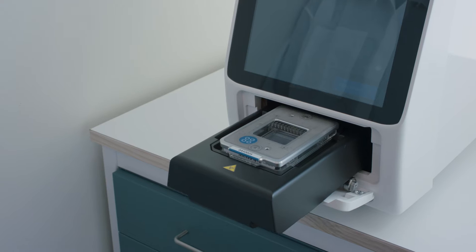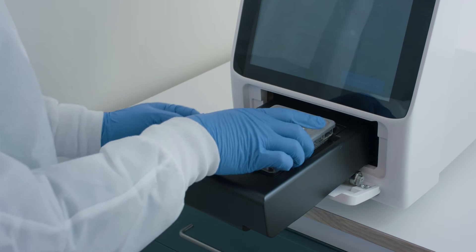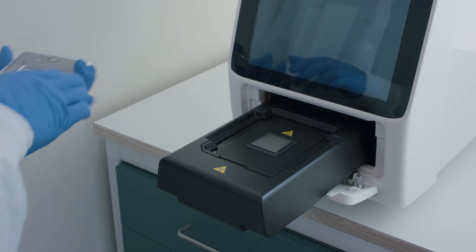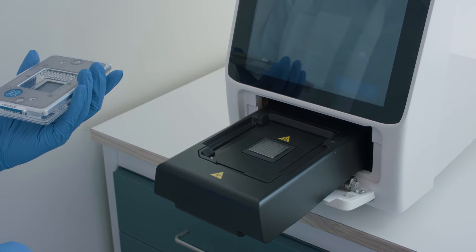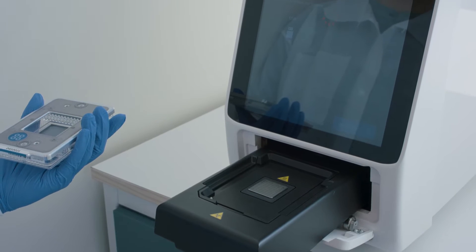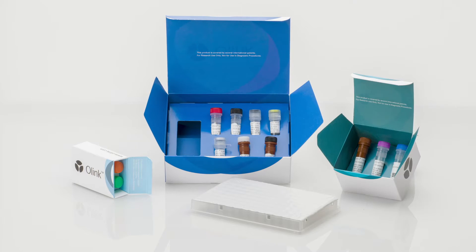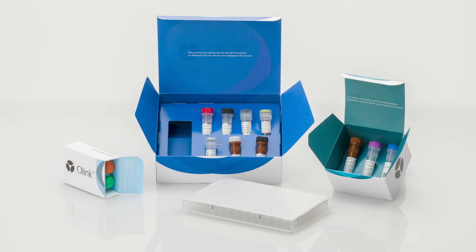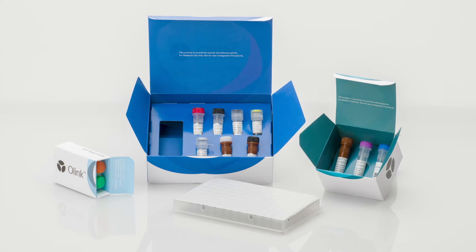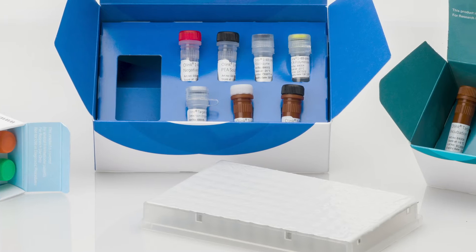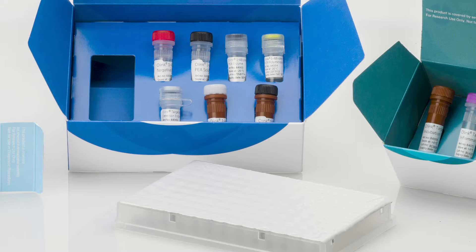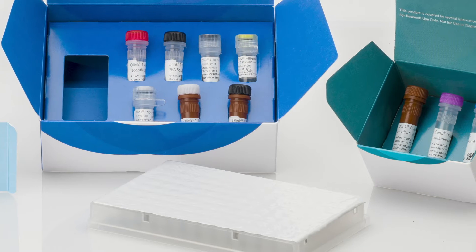Our signature Q100 instrument is specifically designed for QPCR readout of all our Target and Flex panels. The following instructional video illustrates the lab workflow for analysis of a Target 48 or Flex panel. In this video, the Target 48 cytokine panel is used.